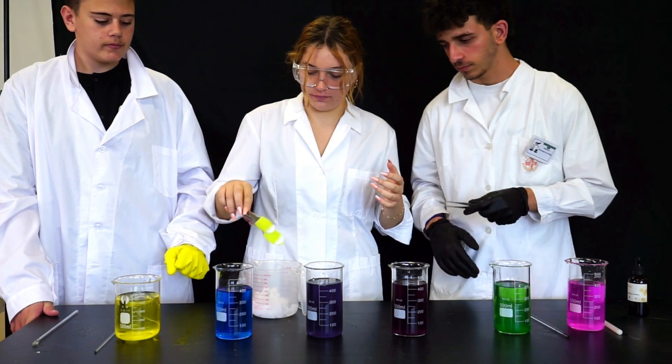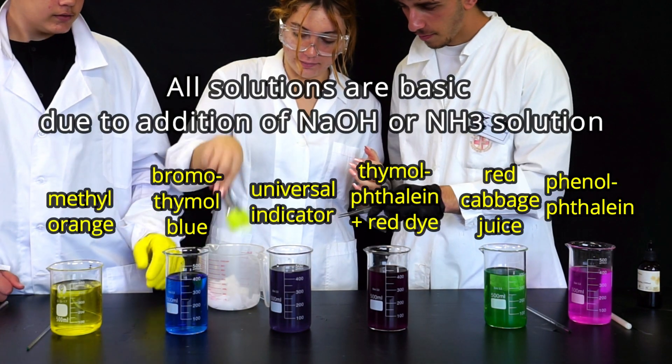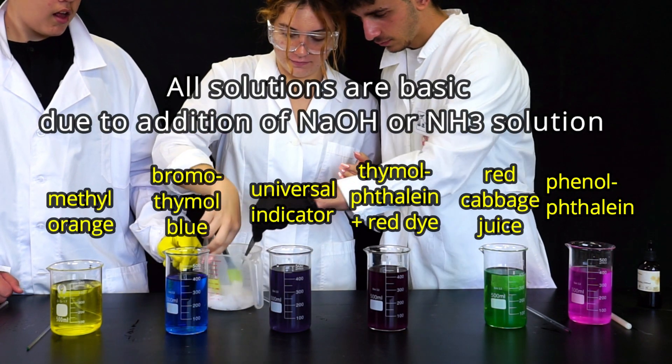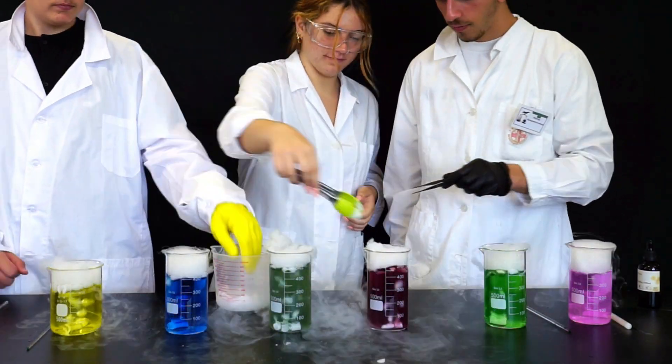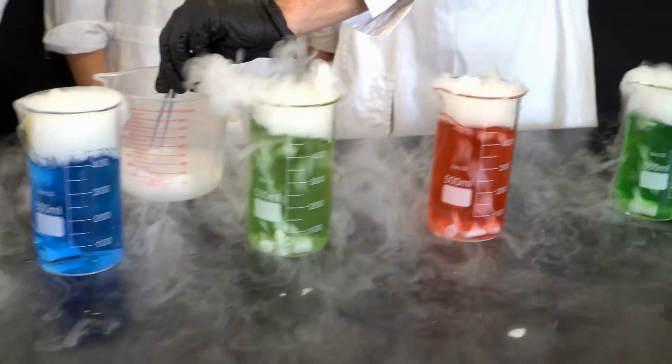Now let's take a close look to color changes when we add dry ice to basic indicator solutions. It is a great example of how colorful chemistry can be.